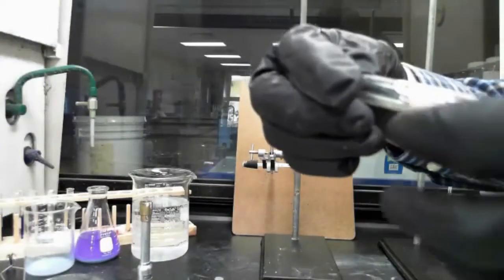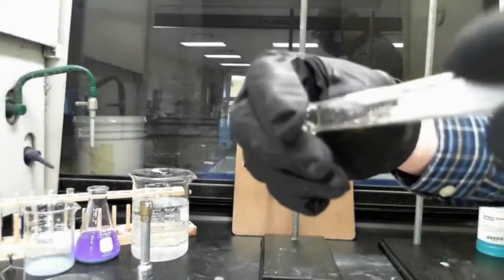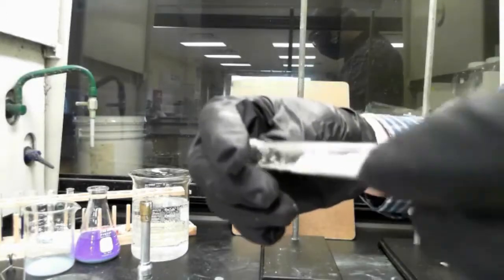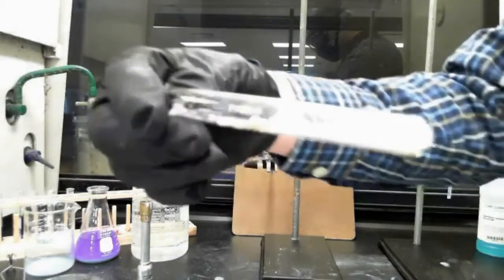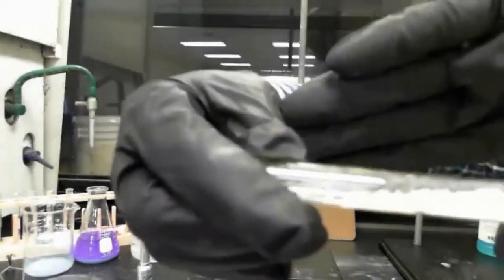I want to spread it out along the test tube so that I can heat the whole thing gently. So I'm going to kind of roll this as I tilt it to kind of, you can see it's now, maybe you can't, it's kind of spread out in that test tube.